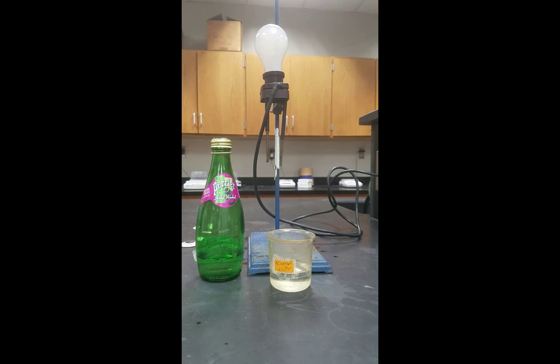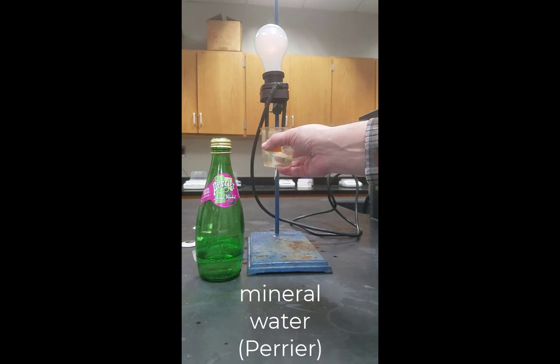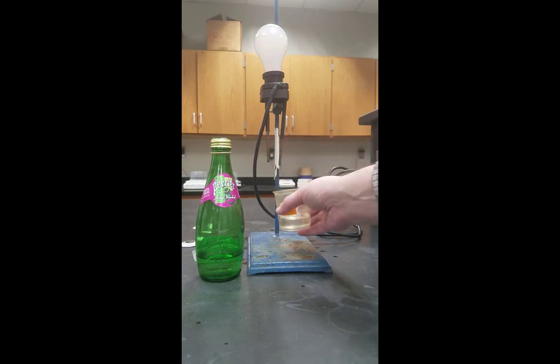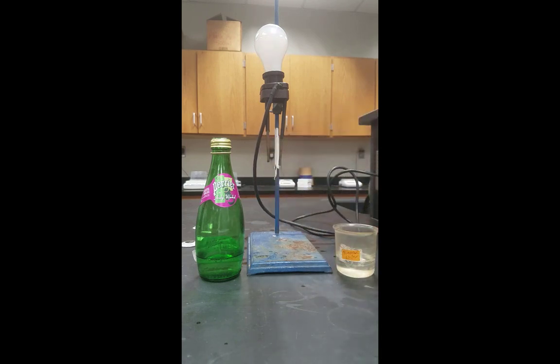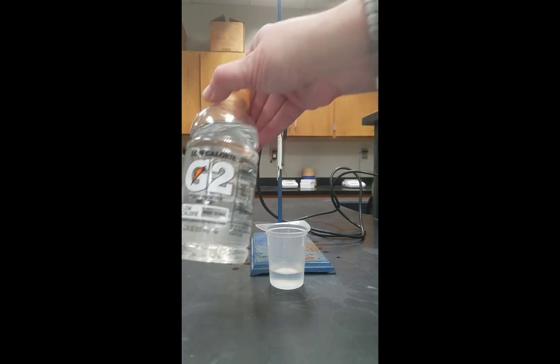Also not shown on the report sheet, but we're just going to test out here, is some Perrier mineral water. Notice that mineral water glows not too dimly, but it is still dim compared to what we would expect for a strong electrolyte. And finally here, we're going to take a look at a Gatorade solution.